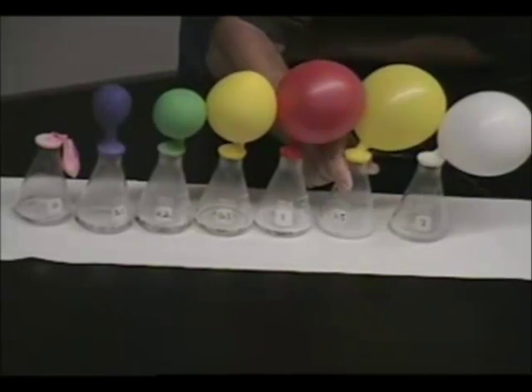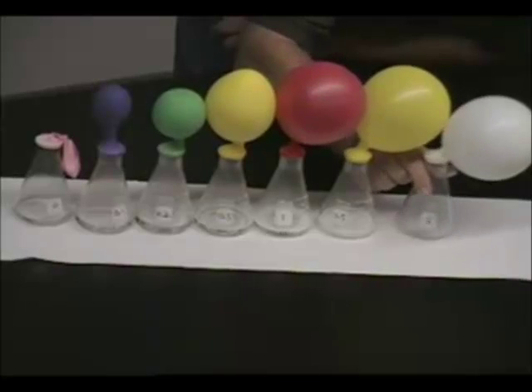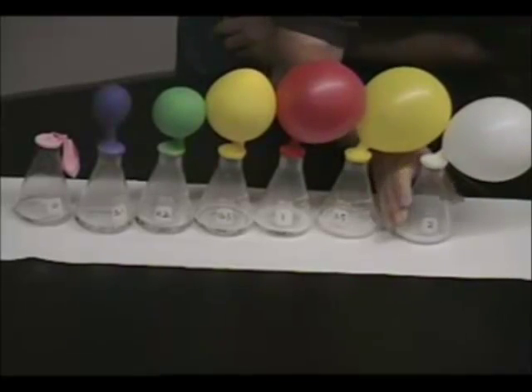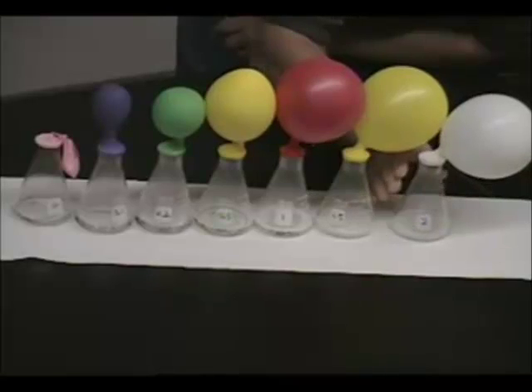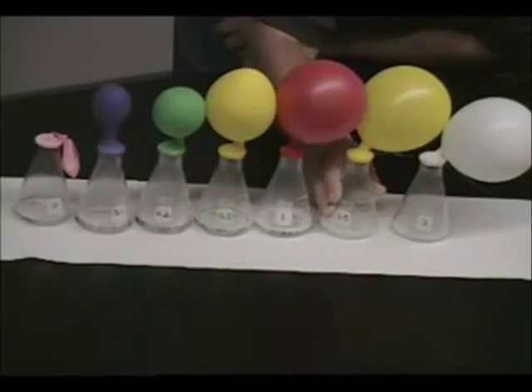It's just about done. Just about done. There's just a little bit of fizz in here. And by the way, these flasks are hotter than blazes. I mean, they are hot.